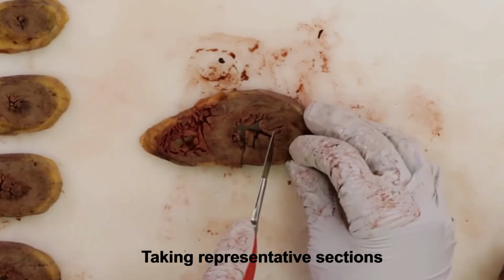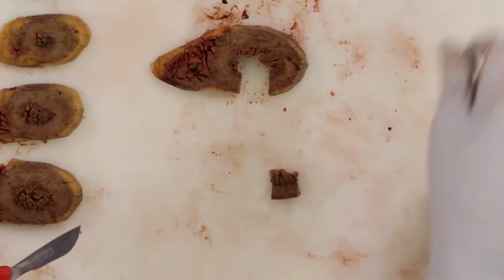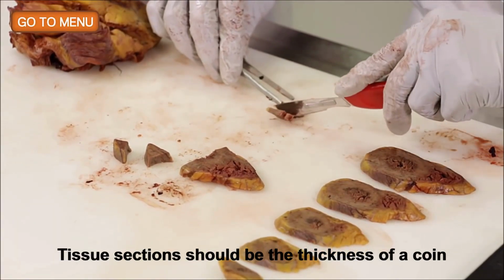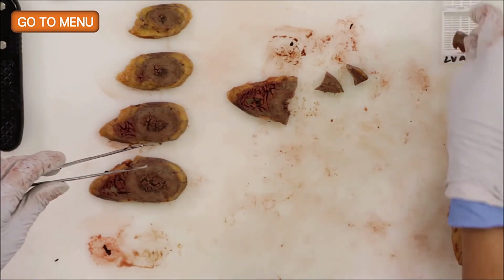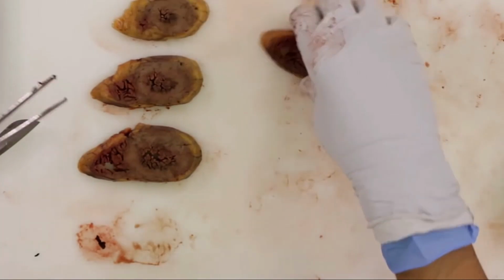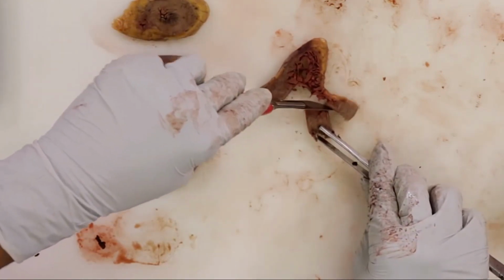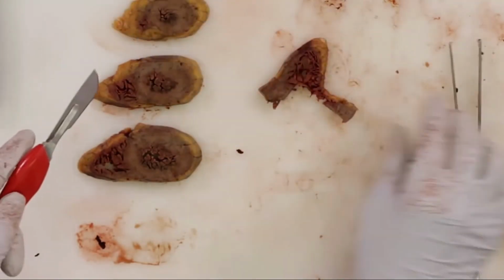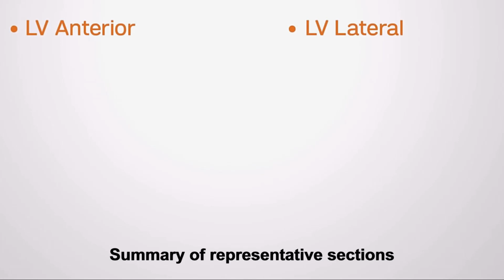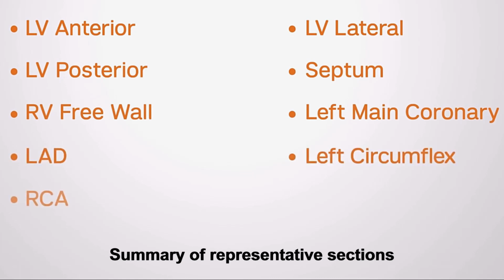In this case, from one of the sections of the heart, we're taking representative sections as we described before in the different anterior, posterior, and this is important, not to produce very thick sections, because otherwise the histology technicians are going to blame you in case that there is no good processing of those samples. We don't want to have it thicker than the thickness of a coin. And be very specific in regards to the areas that are being taken. So this is a summary of the representative sections that we also showed in a previous slide.